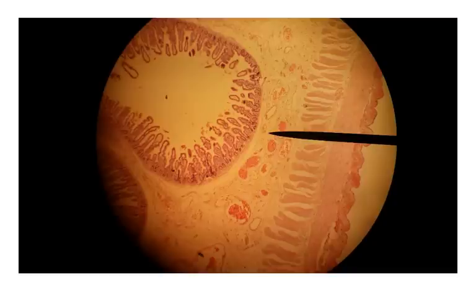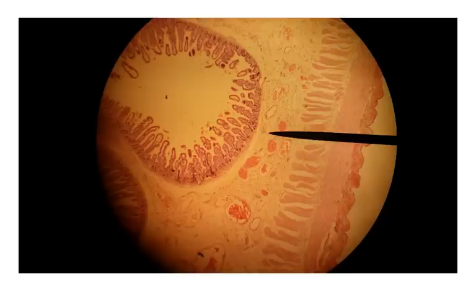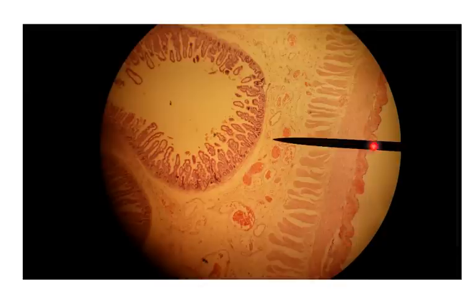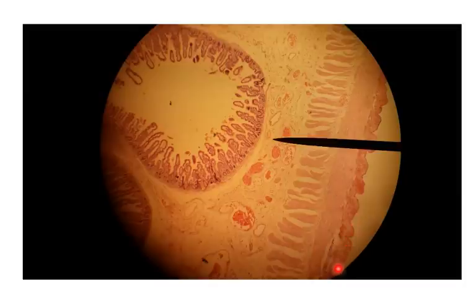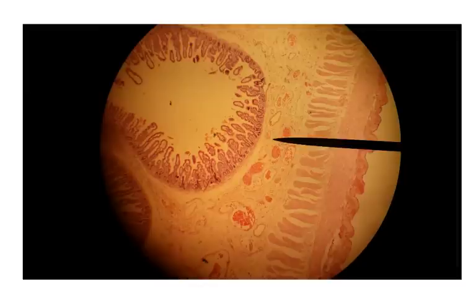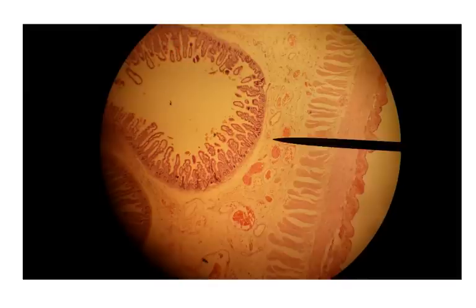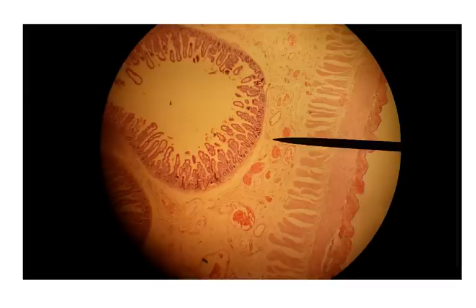Now we've moved into the small intestine. This slide has a lot going on and we're going to look at two different views. Right now we're looking at this area called the serosa — the external wall of the small intestine. When you look at the fetal pig and see the small intestine, this is what you're looking at. Up in this region is the interior of the small intestine where digested material passes through.